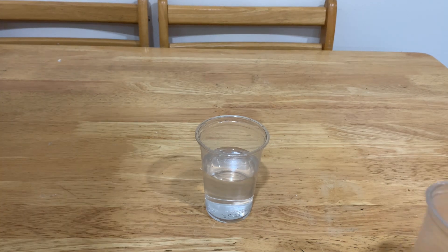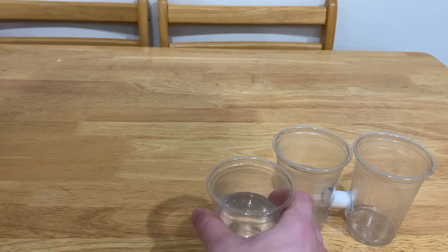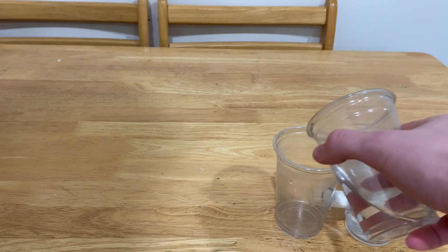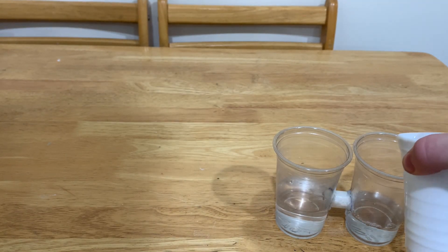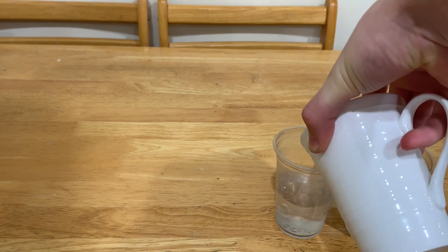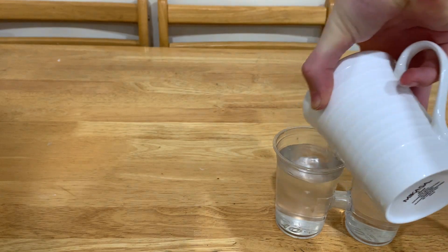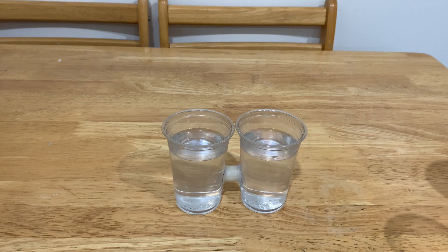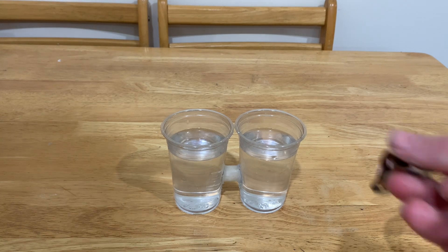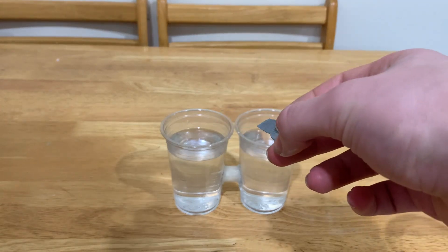Now gently pour the water in on both sides of the apparatus so the cotton membrane does not get blown out. After which, you need to find two materials which can be used as electrodes. Most people use pencil lead, but I use a copper pipe holder and an aluminum plate, which I hammered into shape out of a wire.